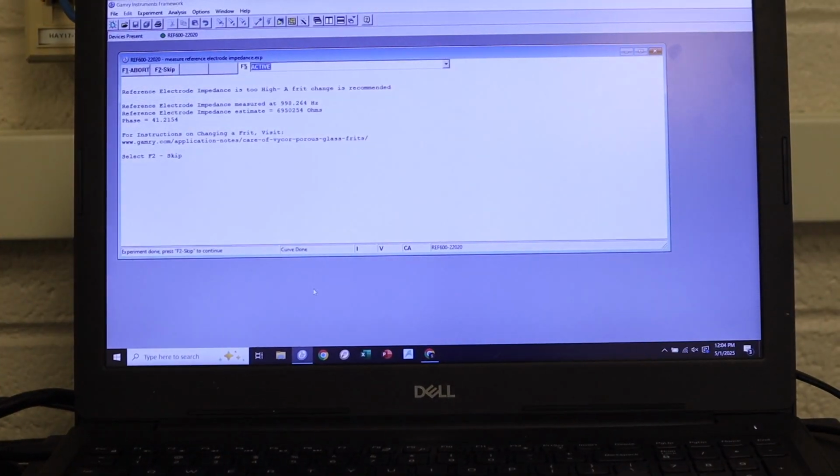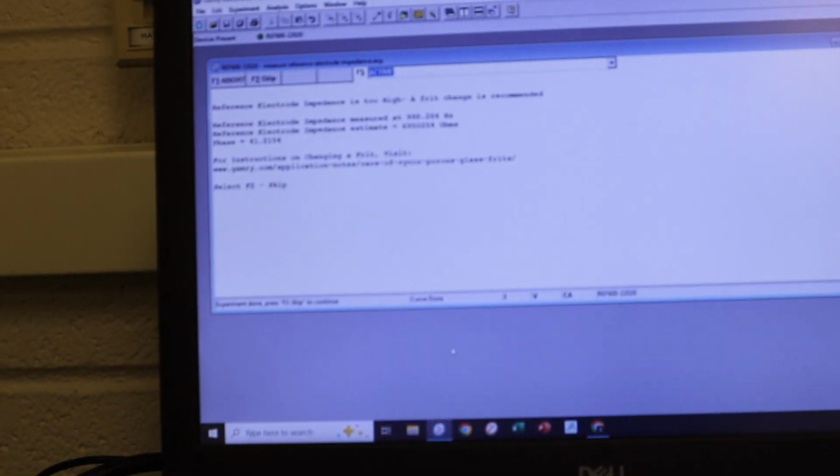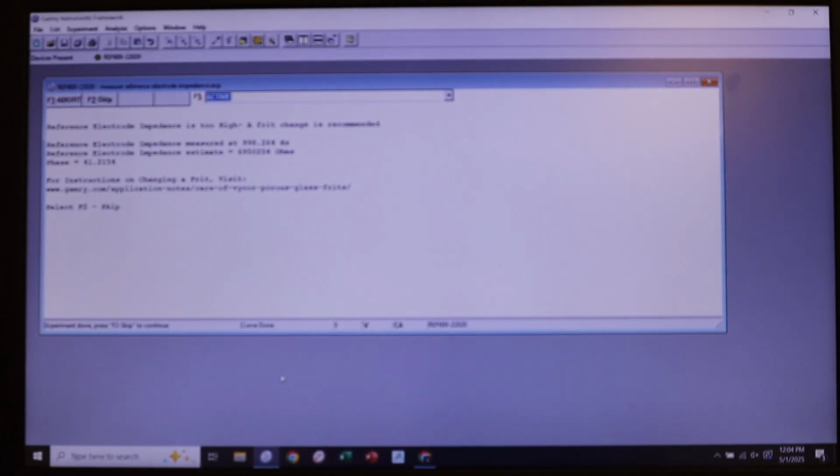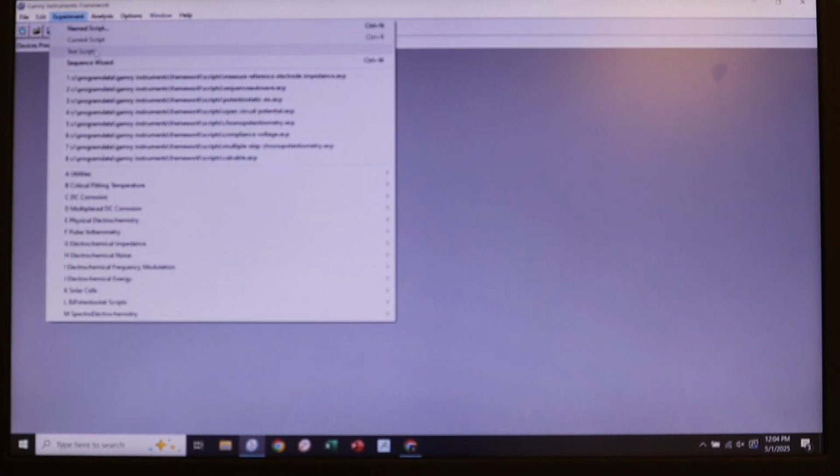So now we'll close out of this reference electrode measurement here. So I keep this stable. There we go. So we'll close out of our reference electrode test measurement. We'll go back to our sequence wizard, and once I change this cable over, that's out of screen, back to the multiplexer cable, like so, we can go ahead and run this sequence. And so again, it's just asking that we've got the right potentiostat, which of course we do. And we're going to replace this data again because we just collected this data that was all faulty.